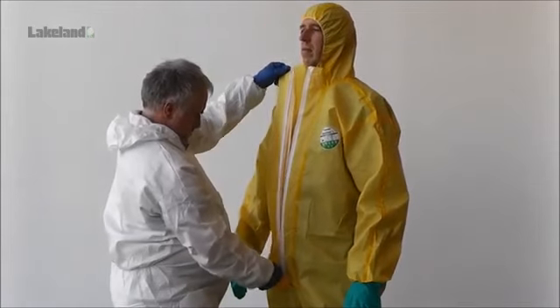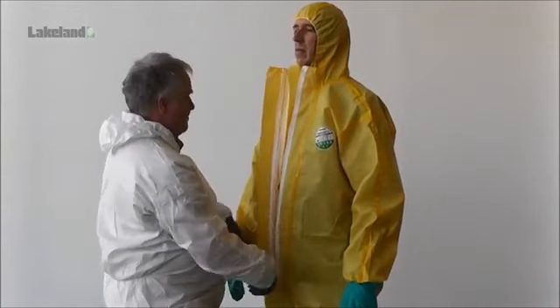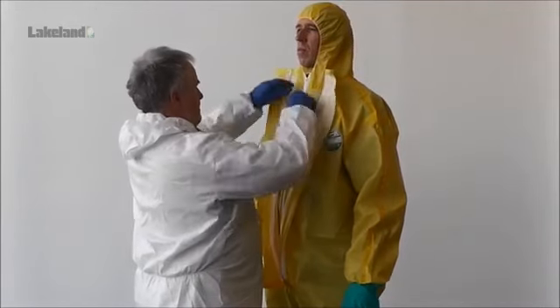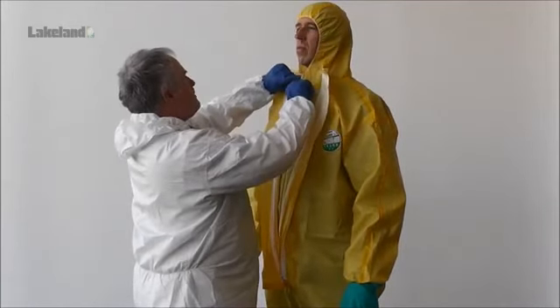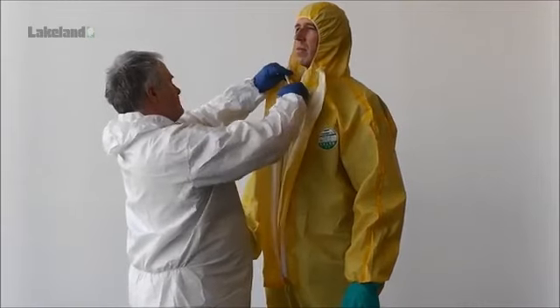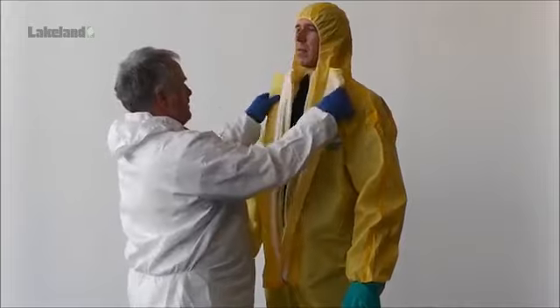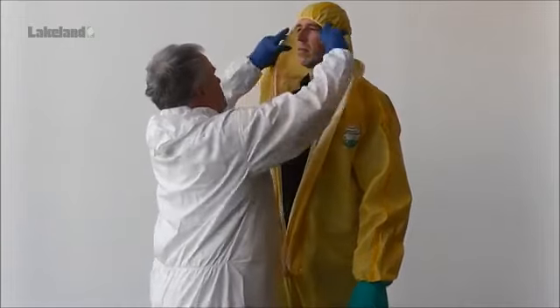This might be only a suitable pair of gloves, but depending on the relative hazard, he or she might also be advised to wear full protective clothing whilst doffing is performed. Here, the assistant is wearing a Lakeland Micromax Type 5 and 6 coverall along with chemical gloves.